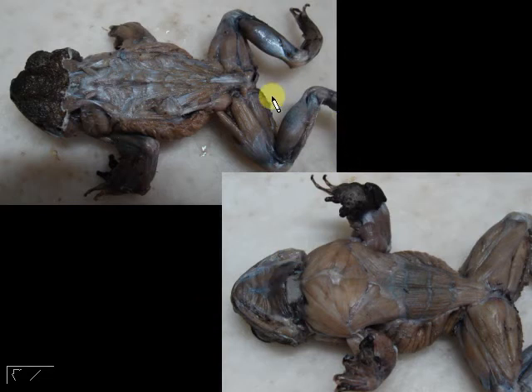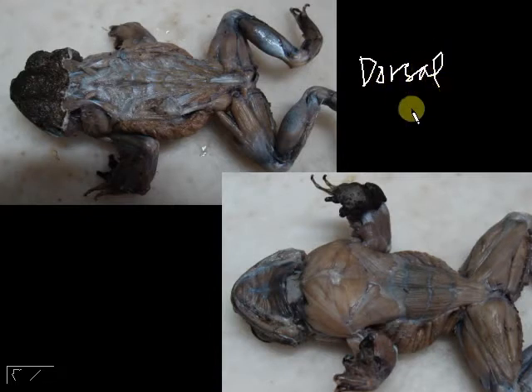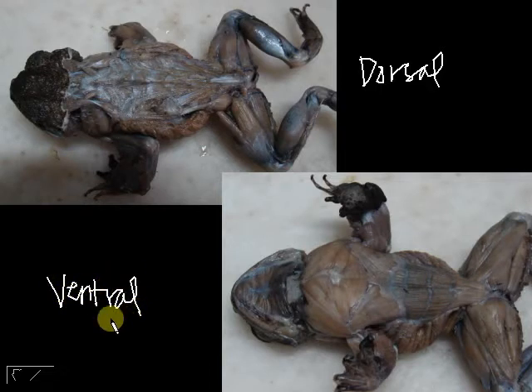First and foremost, let us orient ourselves with a view of your toad. This view right here shows the back, so that is the dorsal view. Then this view is the toad with the belly facing you, belly up. This would be your ventral view. So when I mention dorsal or ventral, you pretty much know what the toad looks like.